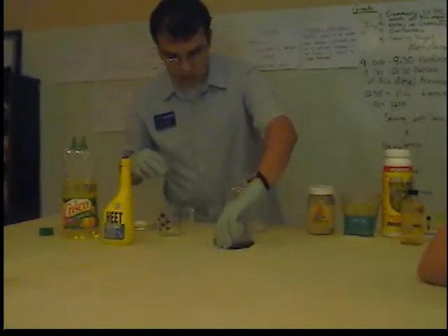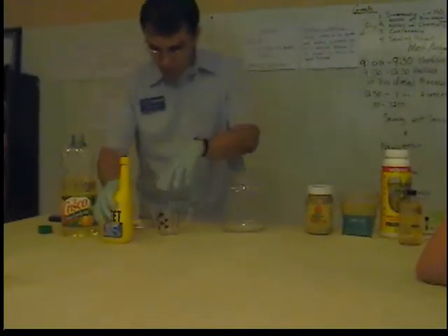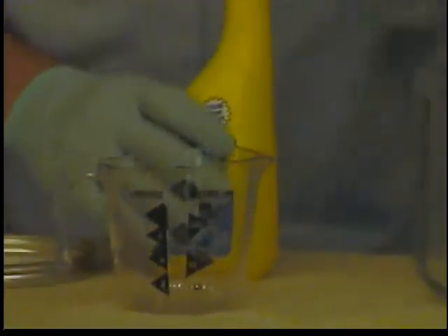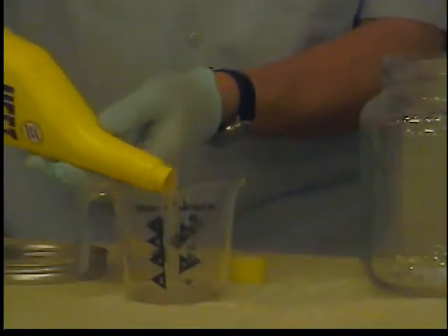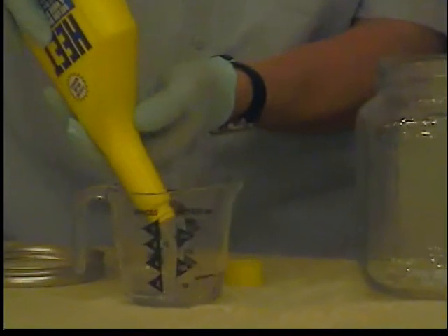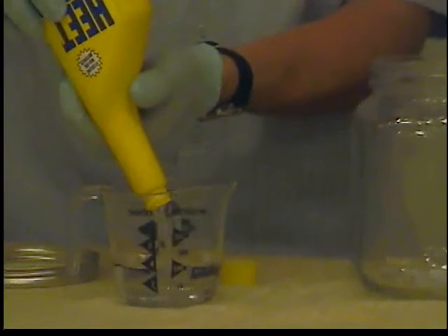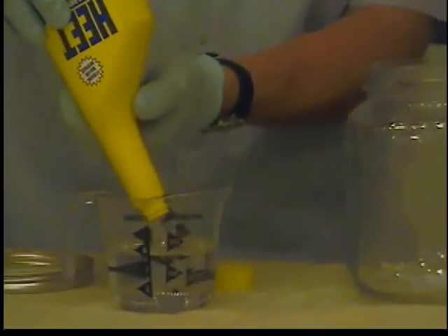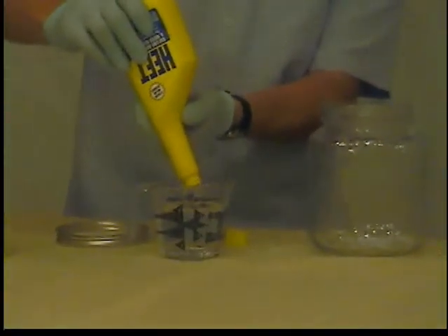I'm going to measure about 250 milliliters of methanol. We want to be very careful when using methanol because methanol is an alcohol. A very common use of methanol is radio-controlled cars and helicopters — if you've ever seen those at Hobby Town USA, the methanol is actually used to fuel those little racing engines. It's also used in professional racing.